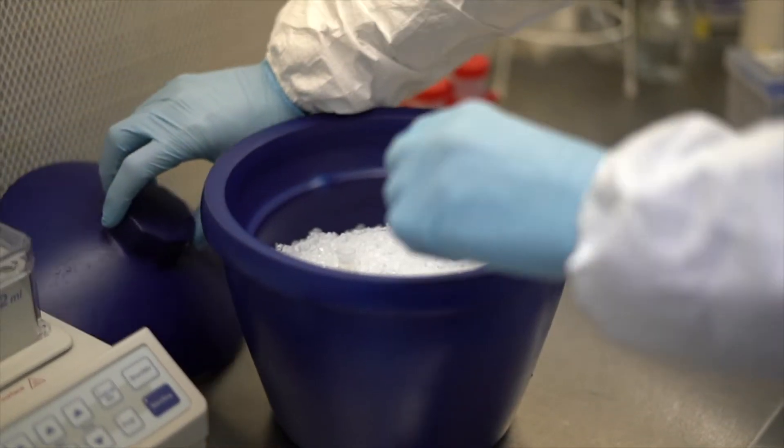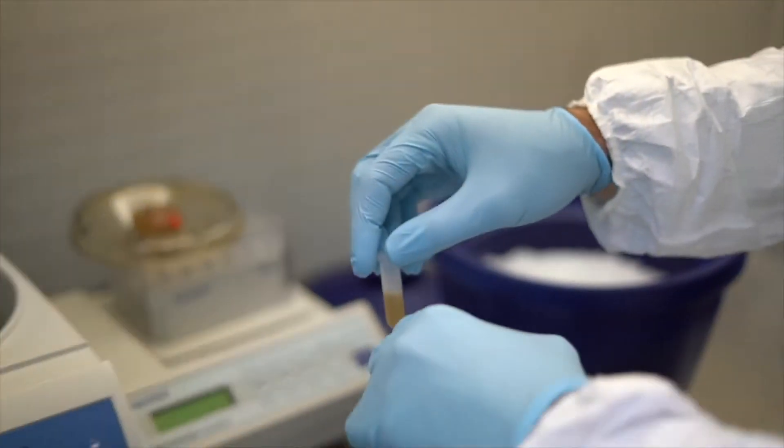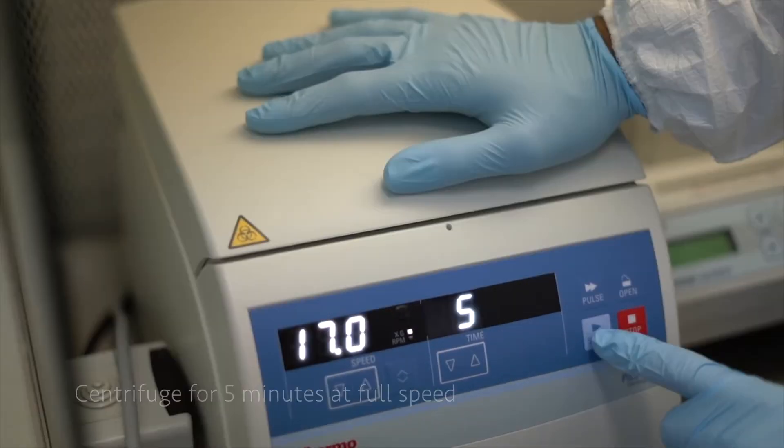Now we have to centrifuge the samples again at full speed in the bench centrifuge for five minutes.